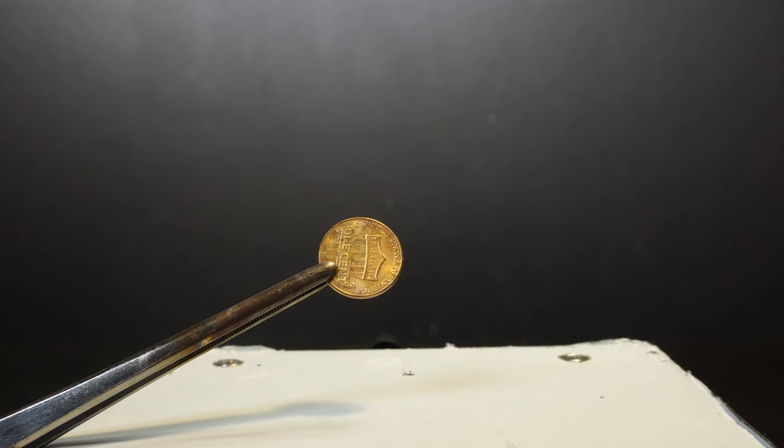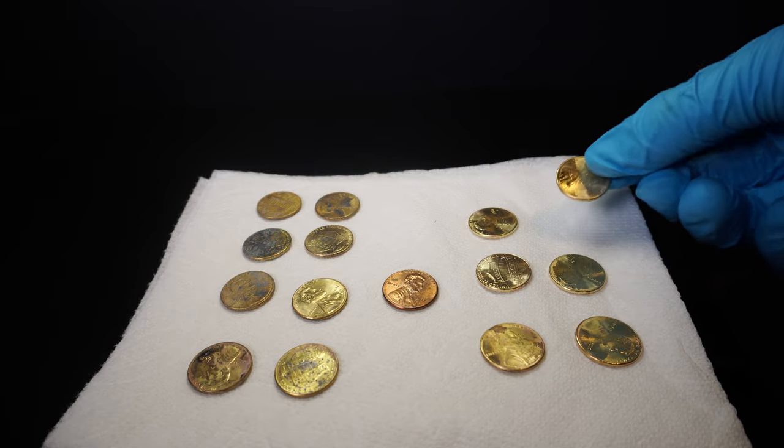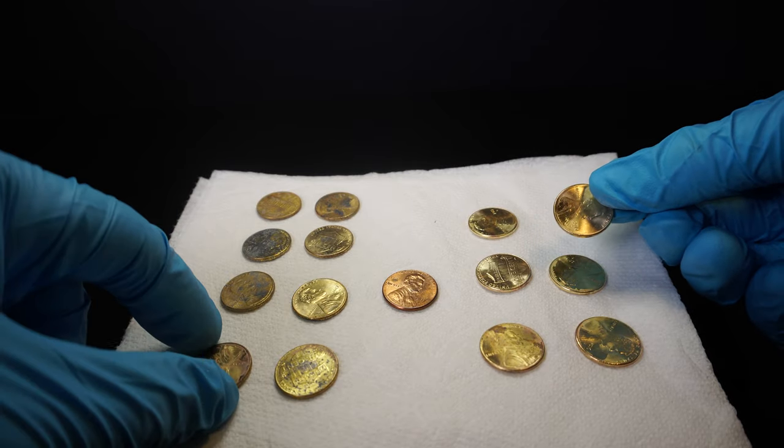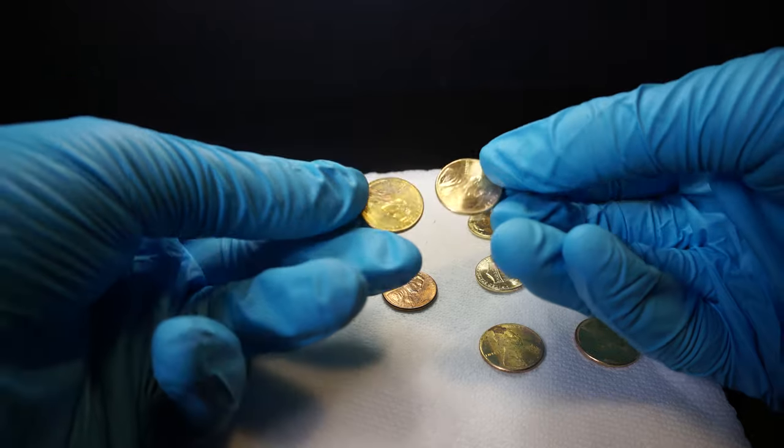In today's video I will be making gold pennies. Now these pennies aren't actually gold and this isn't some new alchemist trick either. This process highlights a copper alloy known as brass.